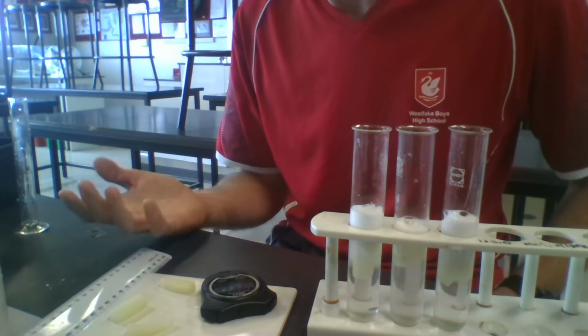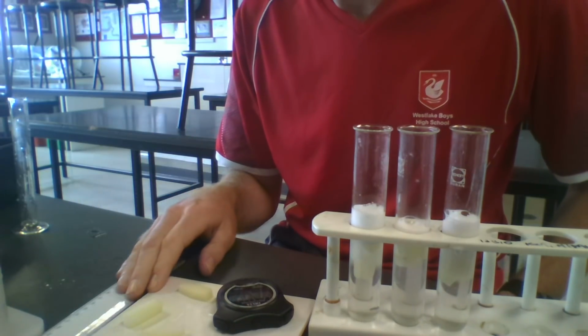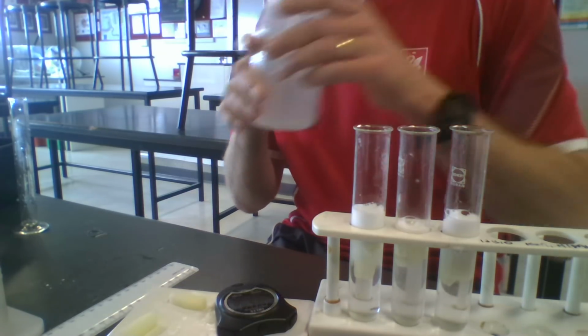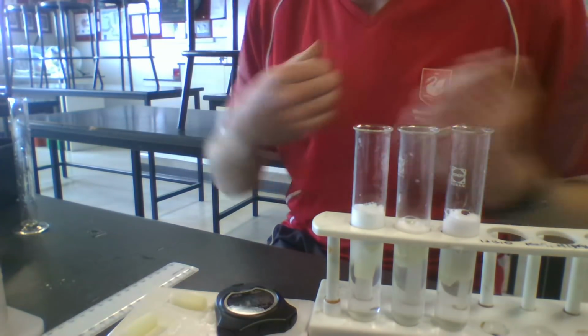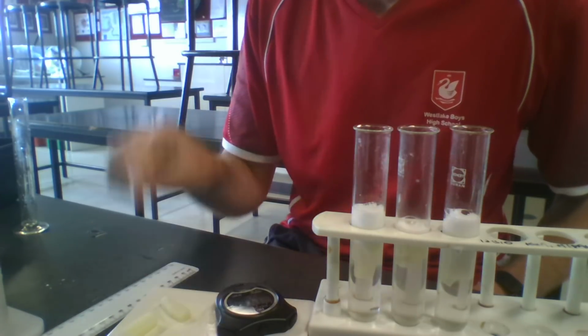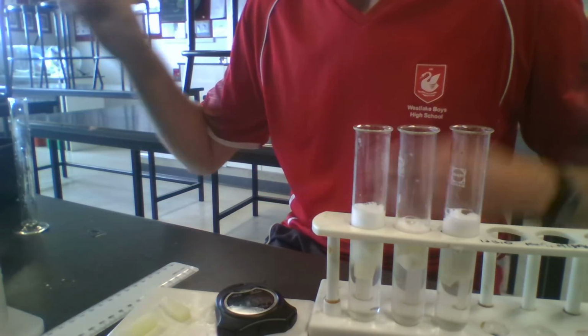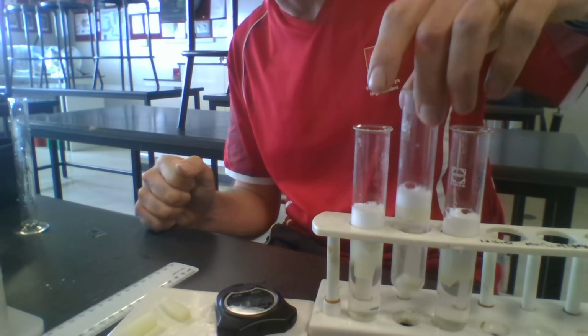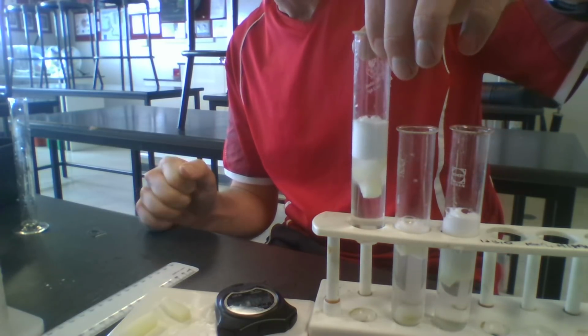and then I can make a graph of those averages to try and tell me what's going on, which is having the greatest effect on the reaction rate between the catalase enzyme and the hydrogen peroxide, and why is there a change? Why is the reaction rate occurring? It seems like it's occurring faster.